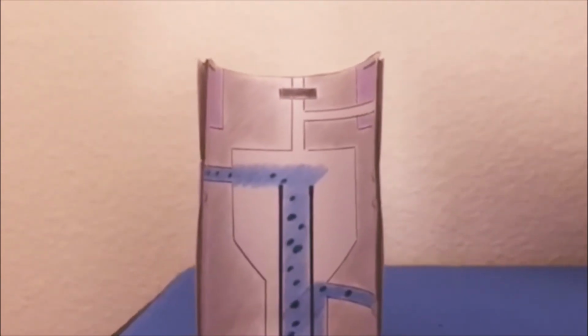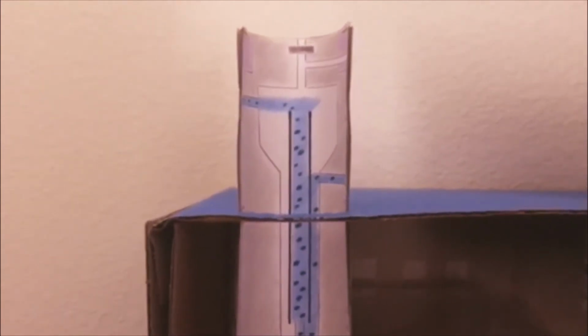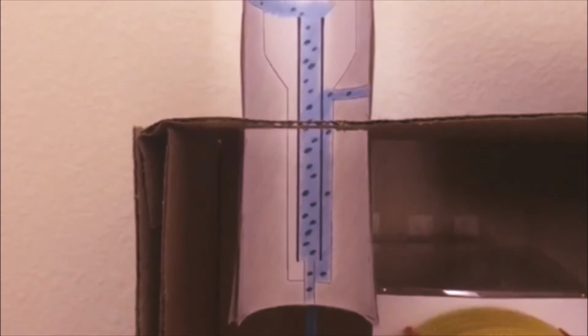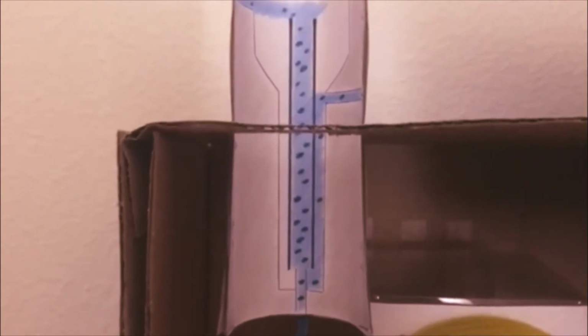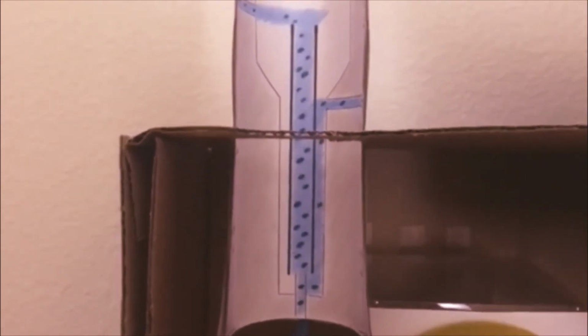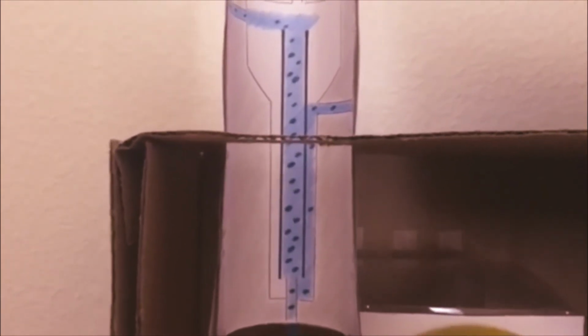The injection port in this particular gas chromatography uses a split injection method. This is the most common method. It delivers a small percentage of the sample injected into the column, about 0.2 to 2% of the sample. Notice that the sample injected has a very small volume to begin with, and through the split injection method, only a very small percentage of the very small volume goes into the column.